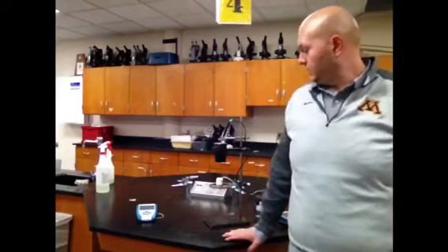Summers, the best part of Armstrong High School, walking you through this lab about how to measure energy in food. We're going to go through some general stuff first, set up independent, dependent, and controlled variables, and then we'll go from there into running the actual lab, for all of you who can't be here or have some sort of nut allergy. So let's start this process with the setup.